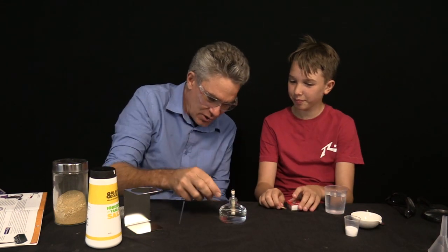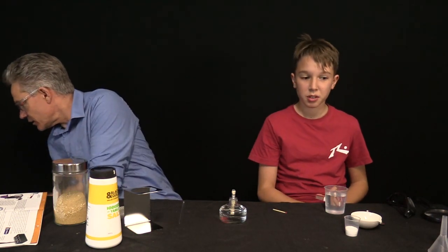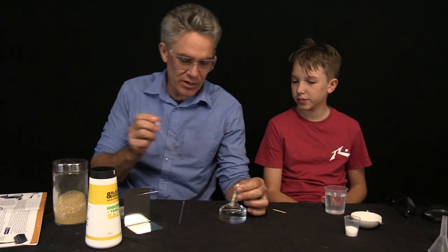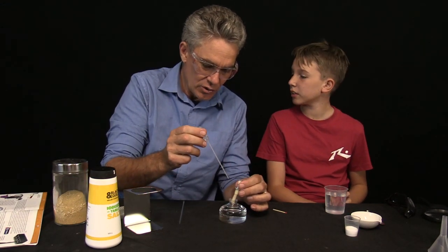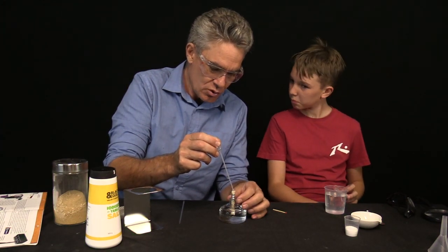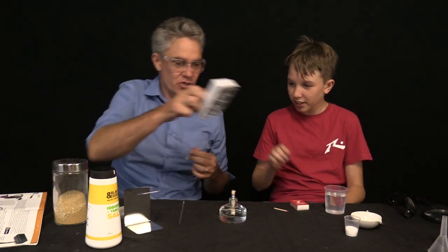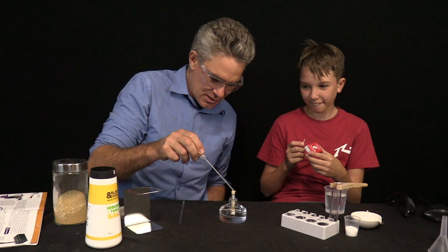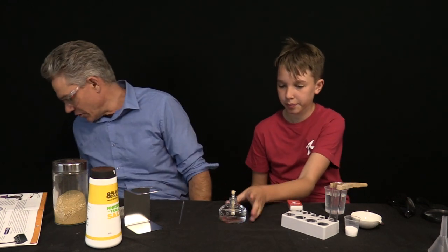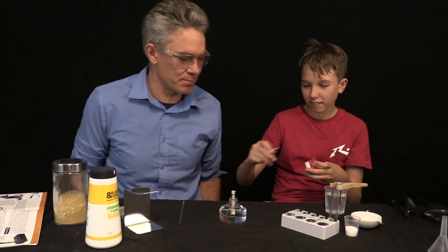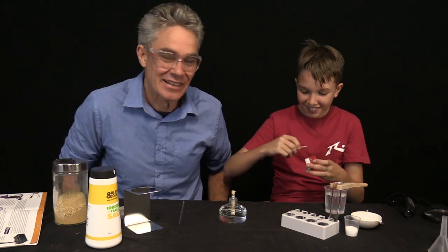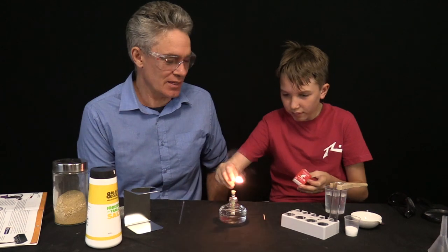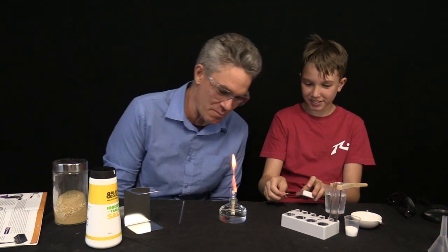I think what might be a good idea is if I get the pipette, squeeze a little bit of fuel up. Can you get the rack so I can put the test tube? I've wet the top of the wick. That will help speed up the process of the water going through. And Sam can light the spirit burner. It's the first time Sam has ever lit a match, it looks like. No, he's actually lit lots of matches before. Years and years. There we go. So that's the spirit burner burning away.